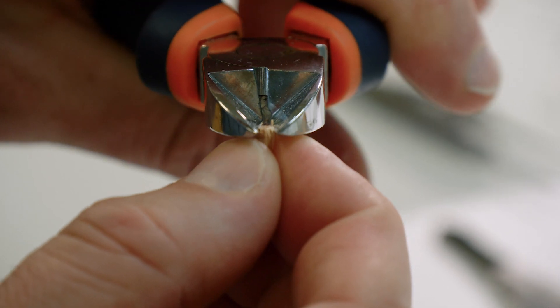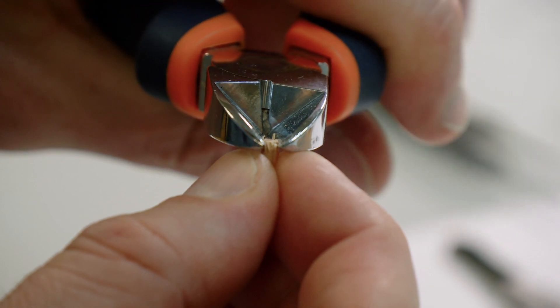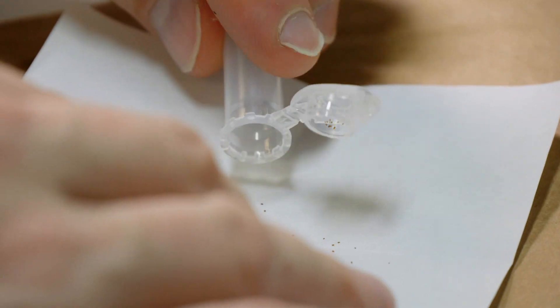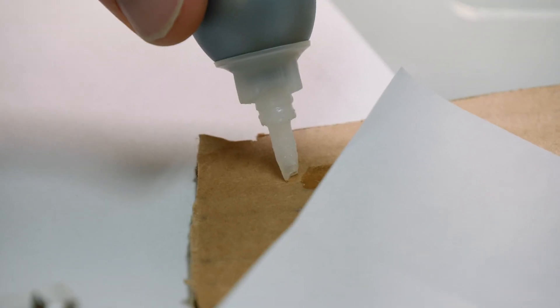Make sure the wood pin base is sufficiently regular to fit into the hole of the goniometer head. We show the procedure again, this time using the wood pin.